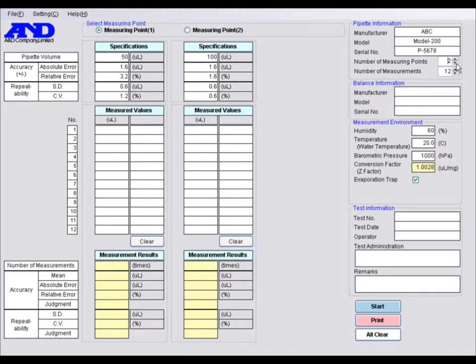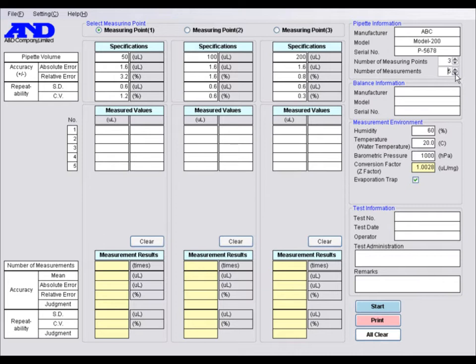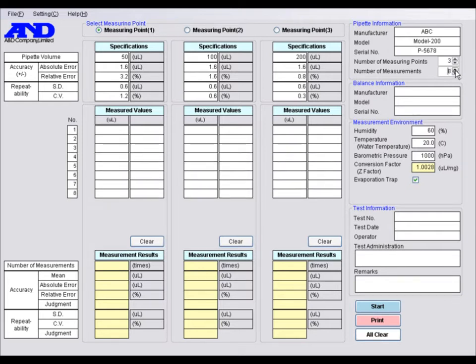You can specify from 1 to 3 measuring points and from 3 to 12 measurements for each point, although the ISO 8655 recommends that you repeat 10 measurements at 3 volume settings. Once you have entered the measuring volume, the software automatically displays the specifications for accuracy and repeatability, with the entered volume regarded as the nominal volume of the pipette.